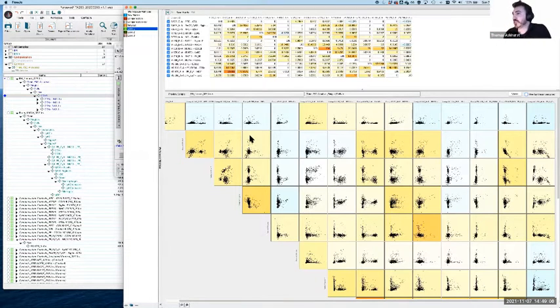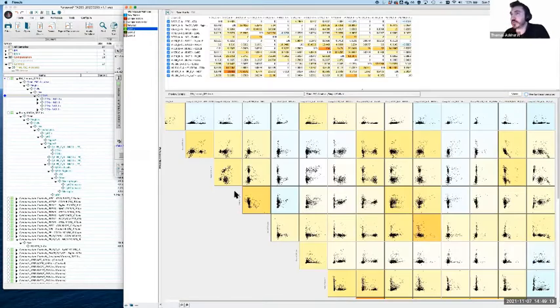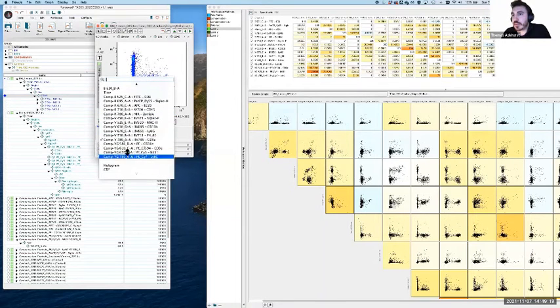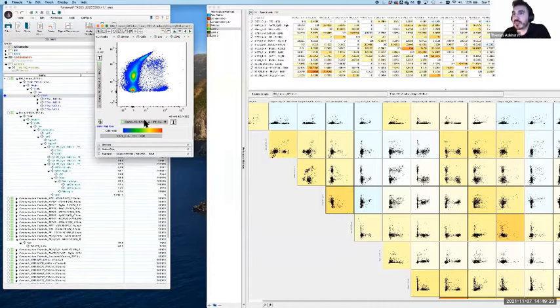That is, in fact, the issue for this panel. No, actually, I'm going to give too much away. I'm going to withhold that information temporarily. All right. So in this case, I'm going to open up. I set this up earlier, so I kind of know what the problems are. Oops, I went too far.